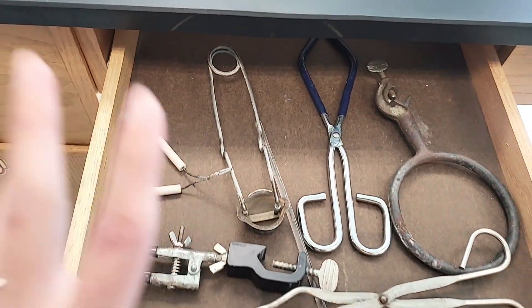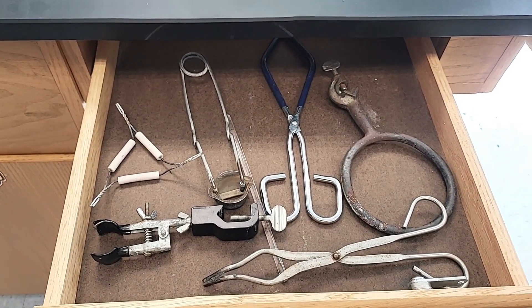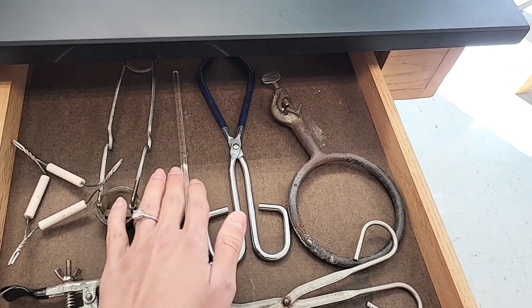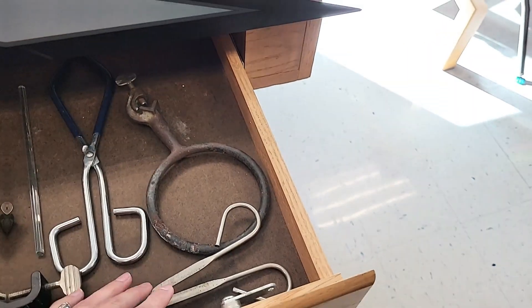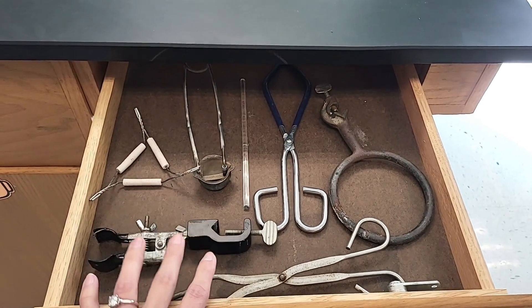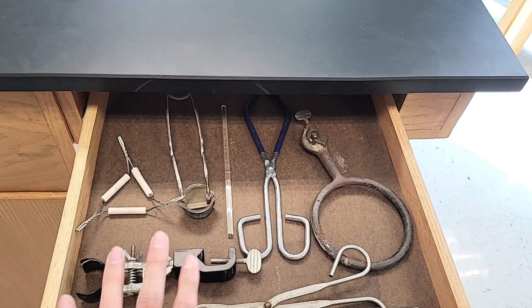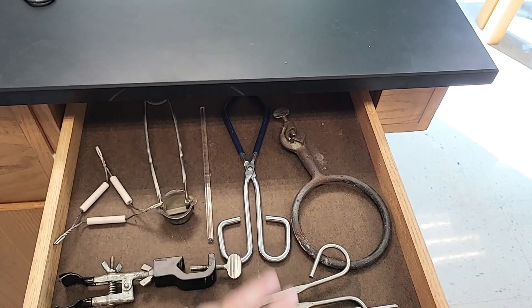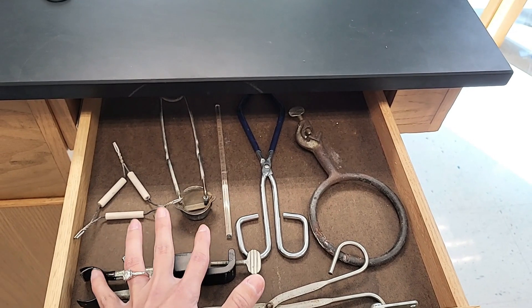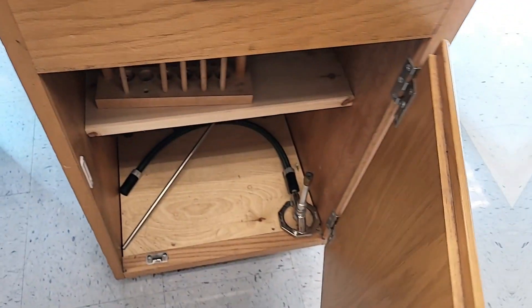In this drawer I've got a stirring rod, striker, clay triangle, test tube clamp, crucible tongs, beaker tongs, and an iron ring. I would really like to put some sort of placemat in here — I actually saw this idea on the AP Facebook group where somebody designed a placemat showing all the equipment in the correct position. I'm strongly considering putting something in here to indicate what's supposed to be in this drawer.